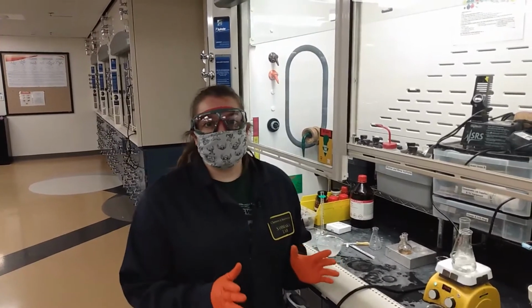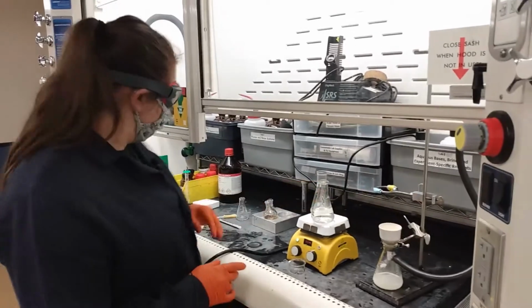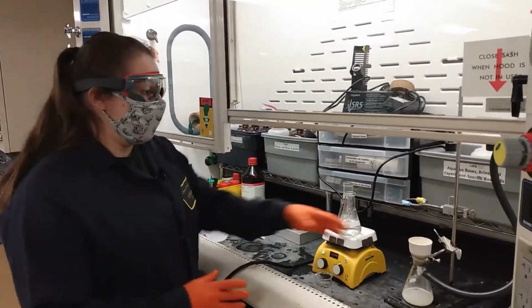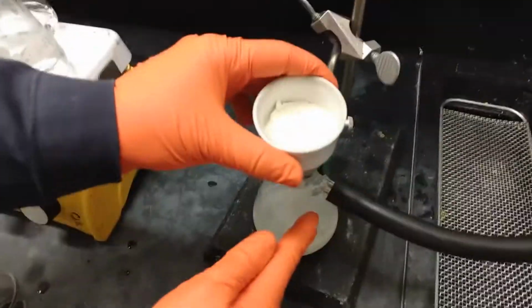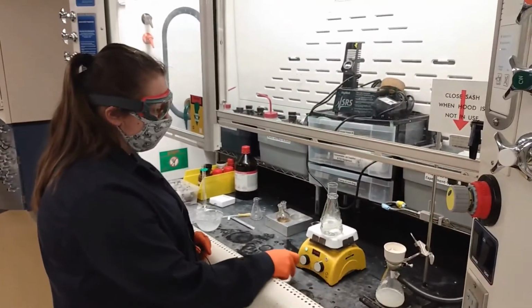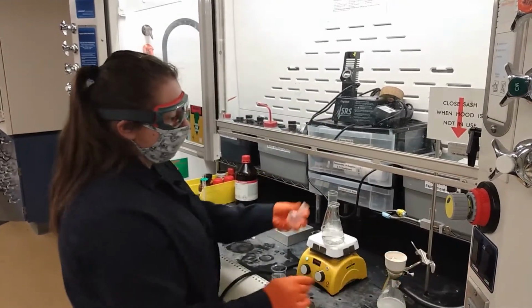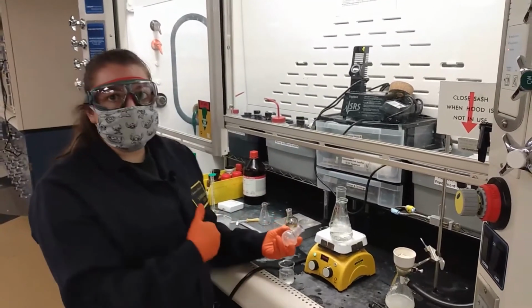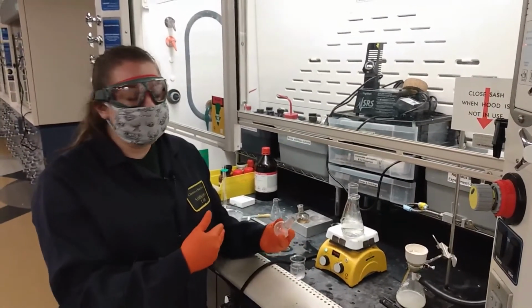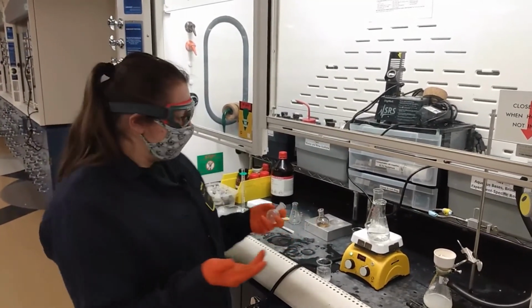So after stirring for about 20 to 30 minutes, what I've done is I've cooled the Pechmann product for about 10 to 15 minutes, and now I've filtered it, and we have this nice yellowish precipitate. And now we can run the recrystallization on it. So I have boiling ethanol. So what I need to do is I need to put this back into the flask, add the boiling ethanol until it's fully dissolved. Then I'm going to chill that down again until I get another precipitate, and then filter that, and then that should be our final product for the Pechmann.